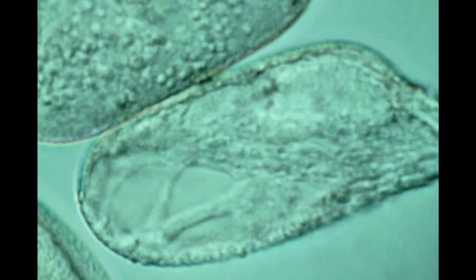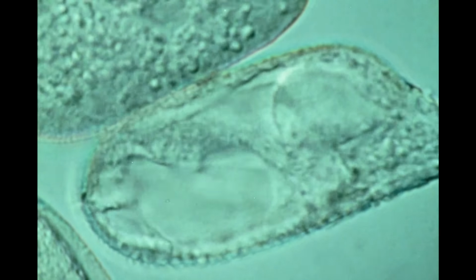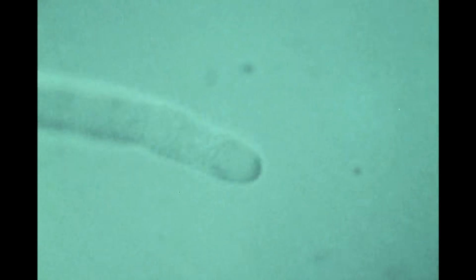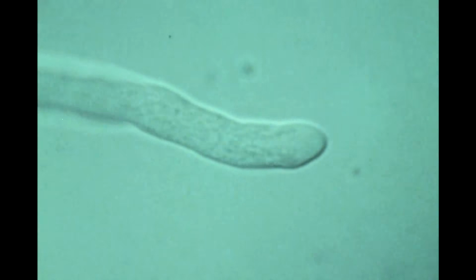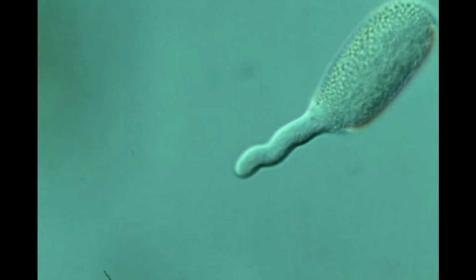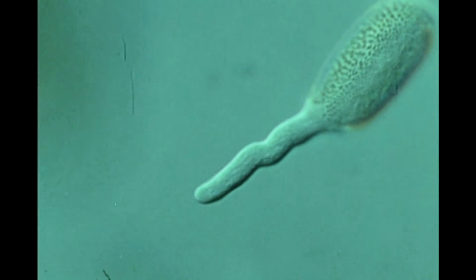The pollen tube, like the root hair, grows only at its tip, unlike most plant cells, which grow over their entire surface. This can be seen by observing that the distance between two bends in the tube, or a bend in the tube and the pollen grain, remains constant, while the distance between a bend and the tube tip increases.